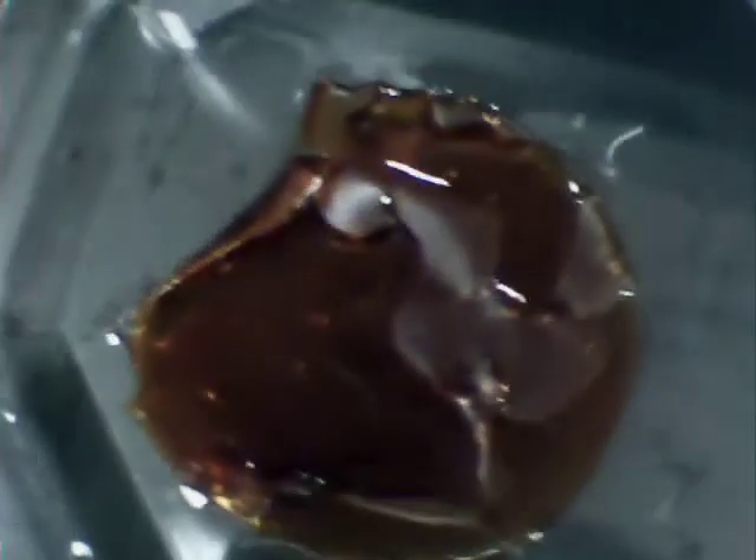The composite includes gum arabic — gum acacia — and what I've been seeing with these is that the net result is a rather hydrophobic material. Given an hour or so it will begin folding up on itself and wind up making little tubes. I'll put one — maybe you could see this tiny one — there it is. Placed in distilled water it will roll up on itself, which is why I'm doing this in a dish instead of a beaker to get a better top view.